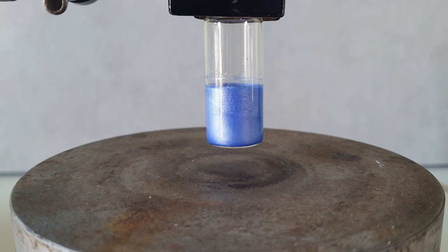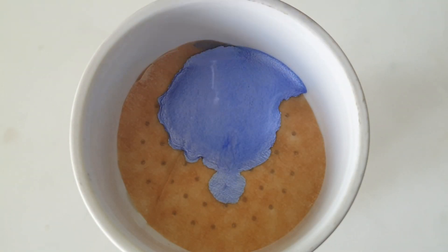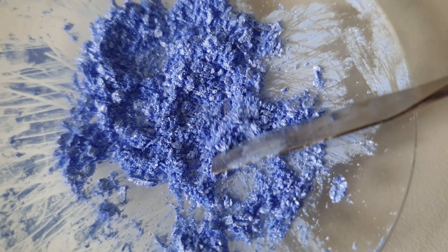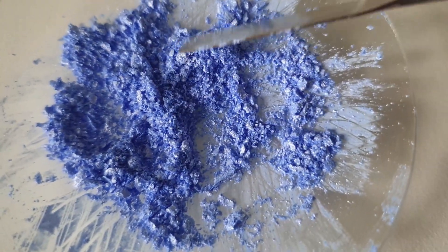And this is how the complex looks after four days of stirring. It's a much more light blue color now, and is very shiny. It has a sort of metallic look to it even, I'd say.